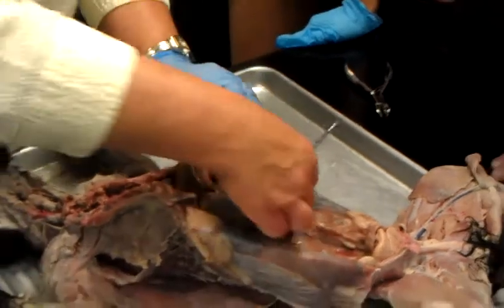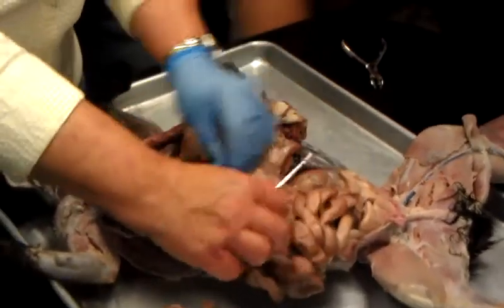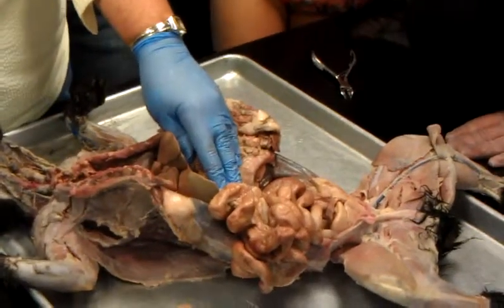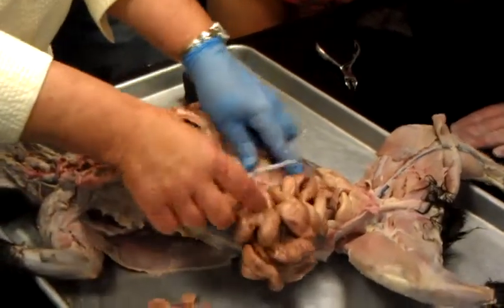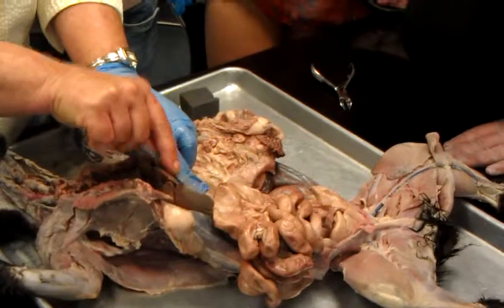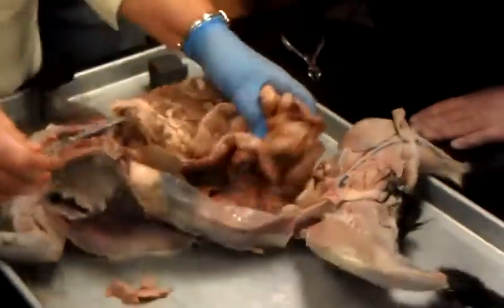And it's real hard to distinguish, but right at the beginning, this is jejunum. All small intestine. Then let's find where the small meets the large. See the difference in size? This is large. So this has to be ileum. If I'm going to ask jejunum or ileum, I have to be at the very beginning or the very what? End. Then here's my large intestine. It's really sort of different in the cat, but this would be the cecum. In the cat, it's a little hard to see, but this would be the ascending, the transverse, the descending, and then down here would be the what? Rectum. Okay?